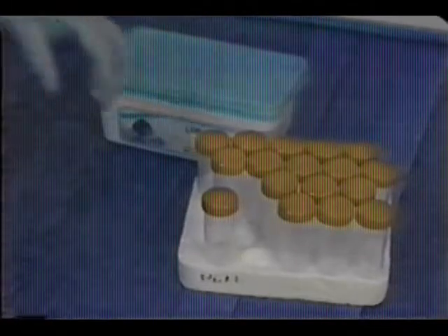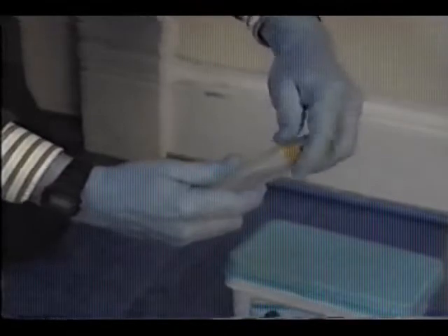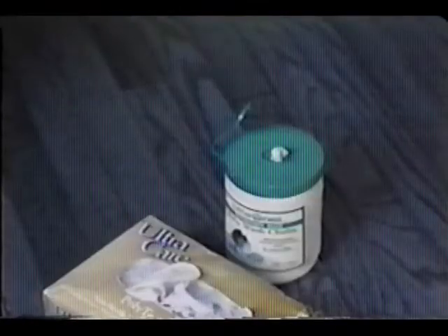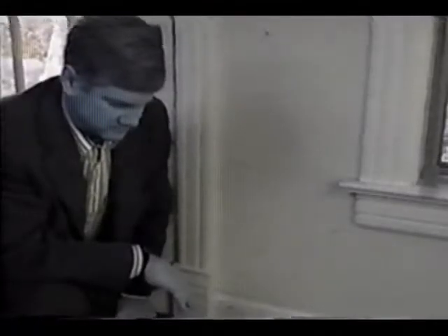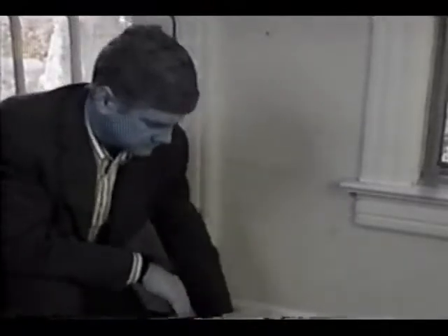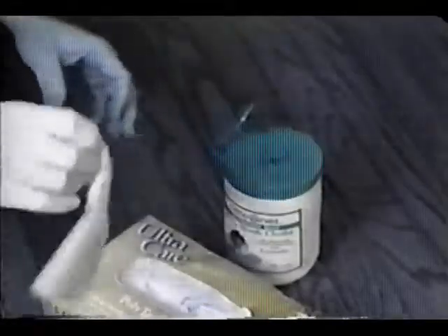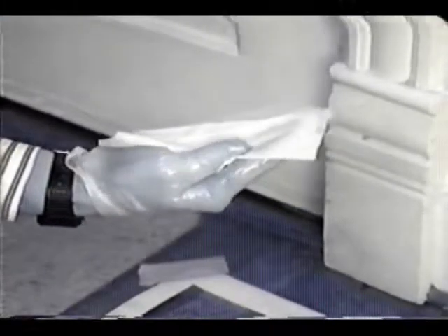Now, examine the centrifuge tube you'll be using. Partially unscrew the cap to be sure it can be opened. The cap should not be placed on the floor. To start, put on a single new glove or a pair of new gloves, depending on your preference. Do not touch anything other than the wipe with your gloved hand. With your gloved hand, remove a wipe from the dispenser and shake it open. Grasp the wipe between your thumb and your palm.